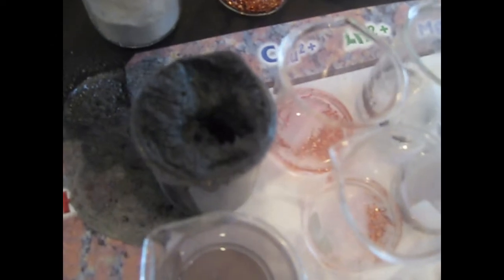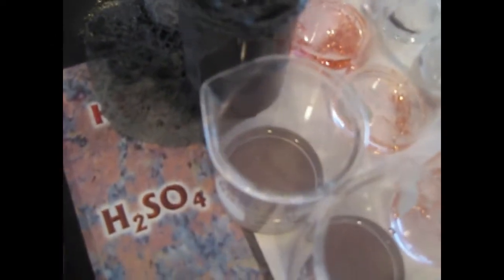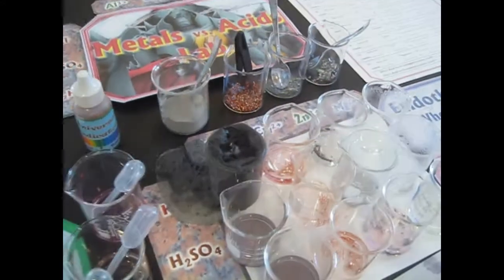And there's actually a big pocket in there. Interesting. Do you all want to break that open with the thermometer? Cut a little hole so we can see what's under there. Yeah, it wasn't all filled up. Okay, that's good. So you can see that it was a big cavity. It was foamed up to the top. Oh, it's sticking to the thermometer.